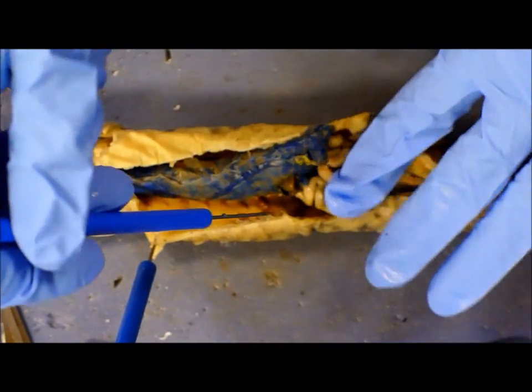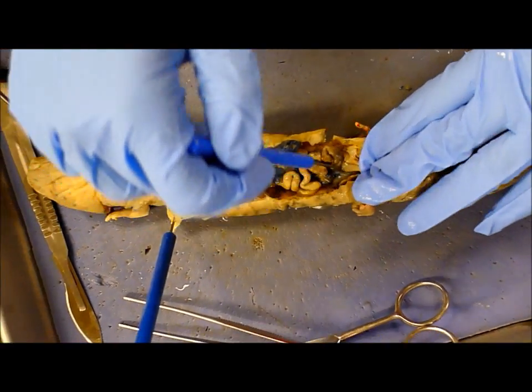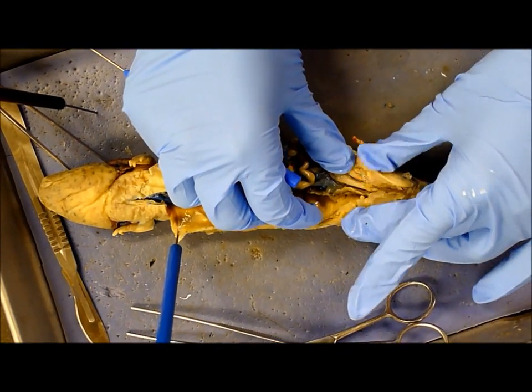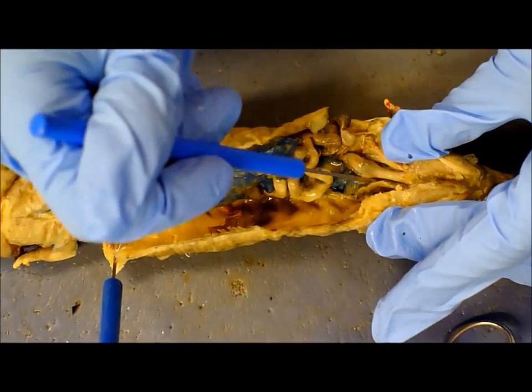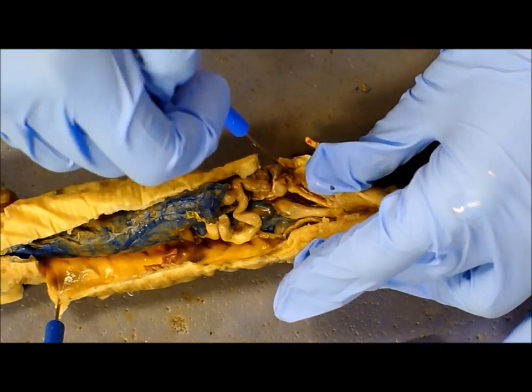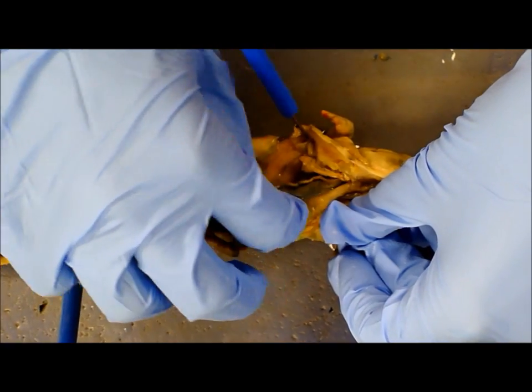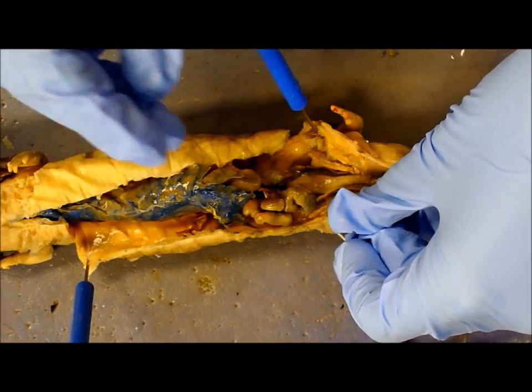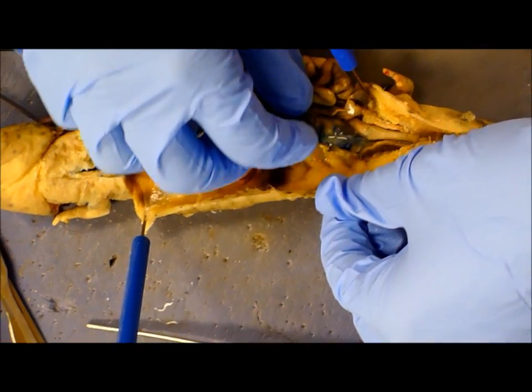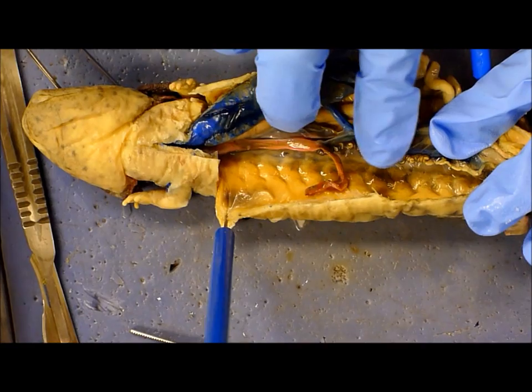And we have a male. The kidneys — to my understanding — are within this area right here, behind the large intestine, and it's kind of like a sac which they lie in, within this region. And then the archinephric duct is this sort of top-ramen-noodle-looking thing right along here.